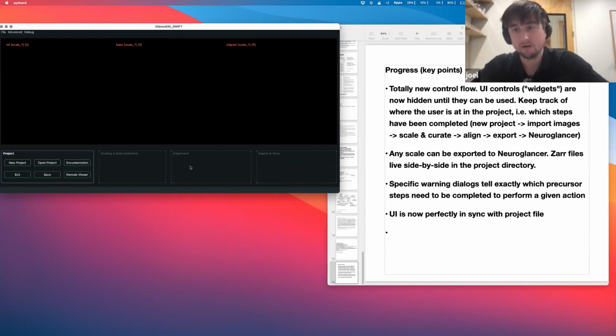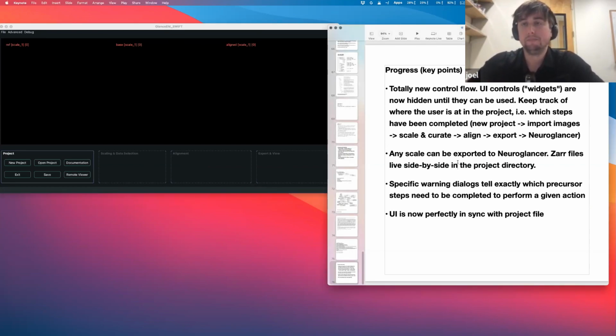And we've got our embedded NeuroGlancer that I've demonstrated in the past. Okay, so there's that. And I'm calling that control flow. People who are in the business of naming things would call that UX flow, how a user progresses through an application, and what the experience is of actually using the application.